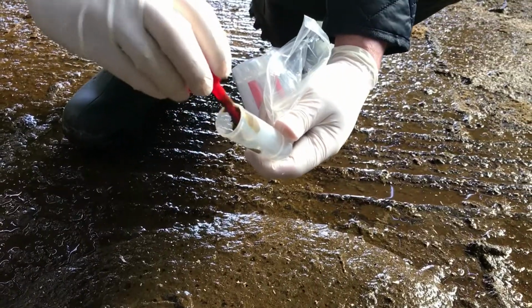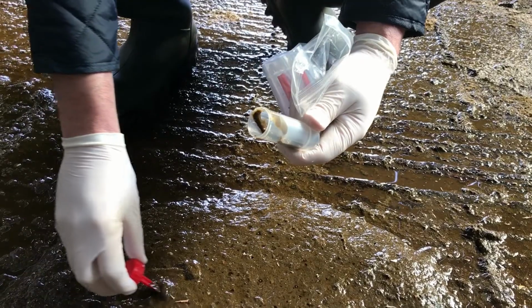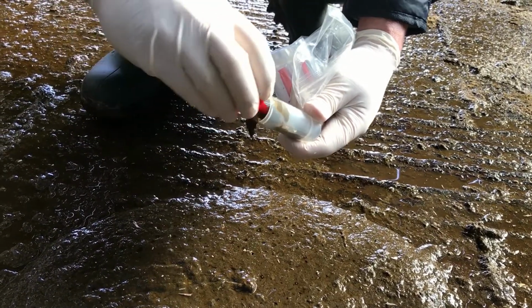Essentially, it's a very simple procedure, but we do get these questions. How do you do it? Which type of bottles do you use? Which samples do you take? Do you need to take it directly from the cow? Everything else like that. I suppose the key thing with any of these things is just go and do it. Just take the sample.